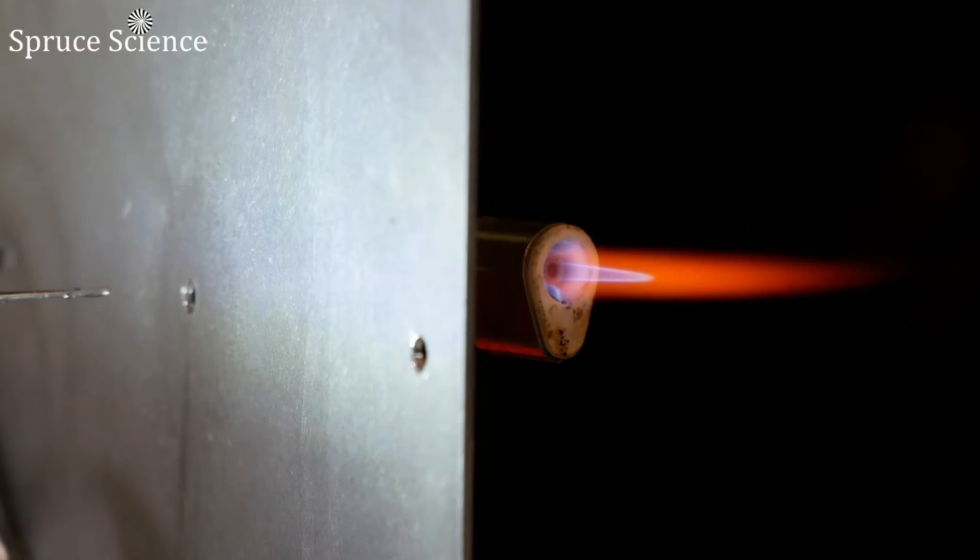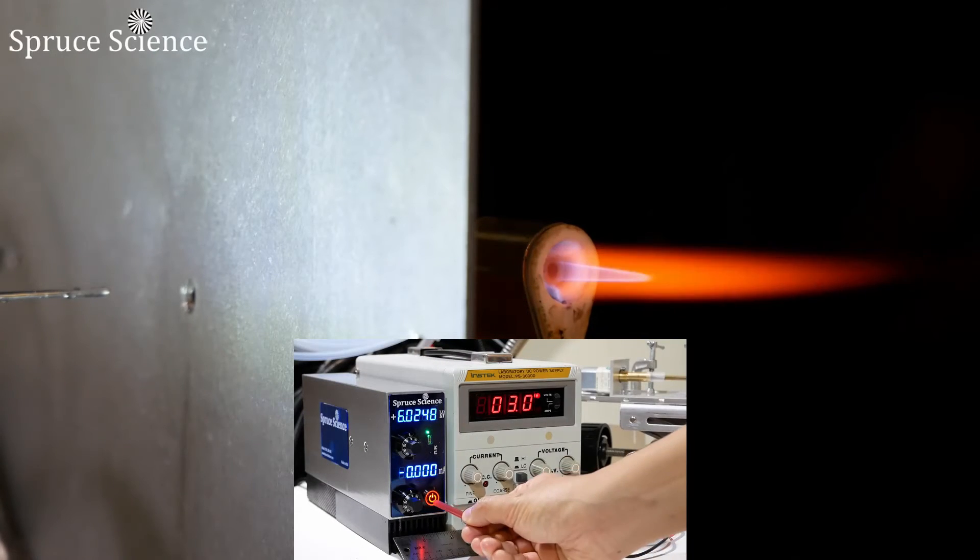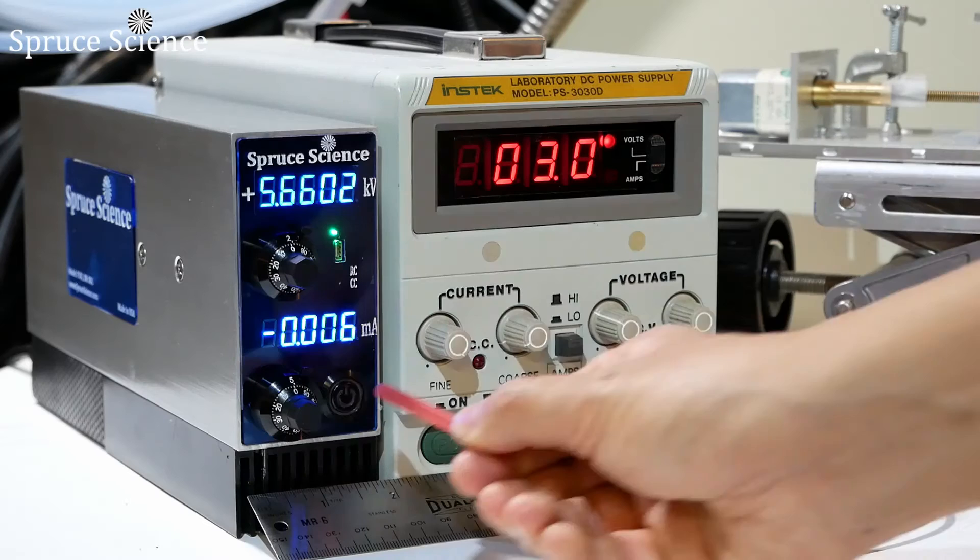This analysis method is such a great way to detect alkaline metals and demonstrate how useful it is to have a precision high voltage power supply that is compact, lightweight, and versatile.